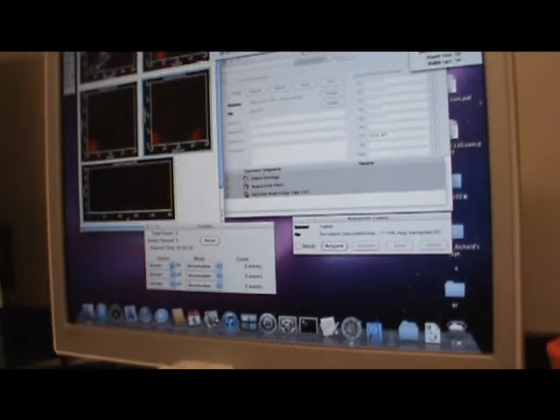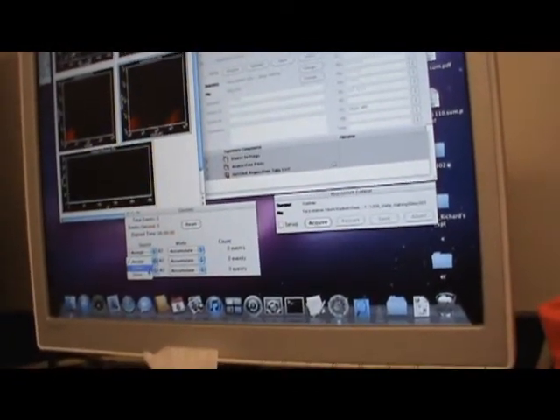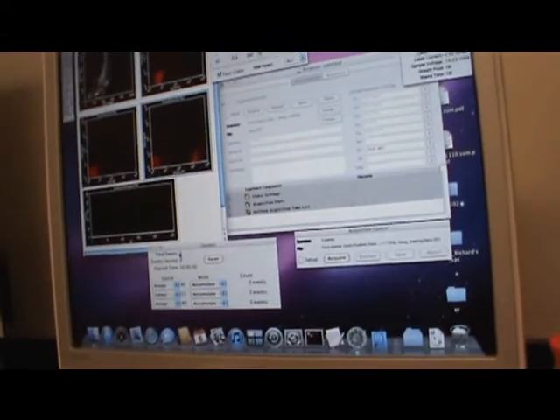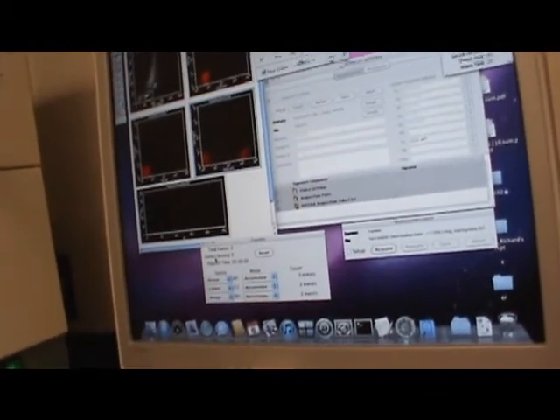Now the next thing is go to counters, because you want to keep track of what is going on. Open up the plus sign, and accept all events. Here it will give you the total number of events being recorded and events per second. You can look at the screen and tell, my sample is too dilute, or my sample is too concentrated. This counter is just for visualization. This is what you need for recording, but this is for you to visualize. And this comes from the acquire counter window.